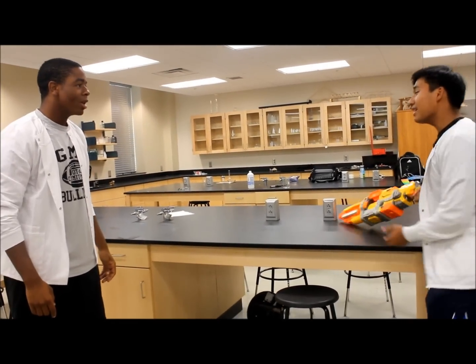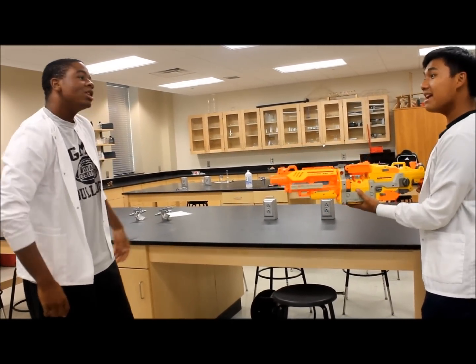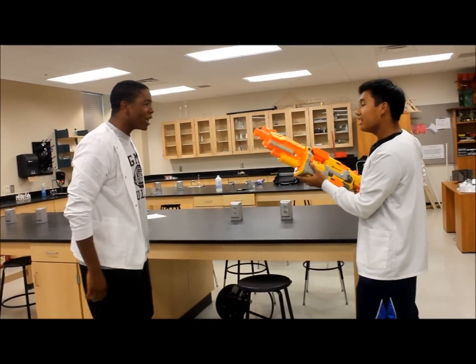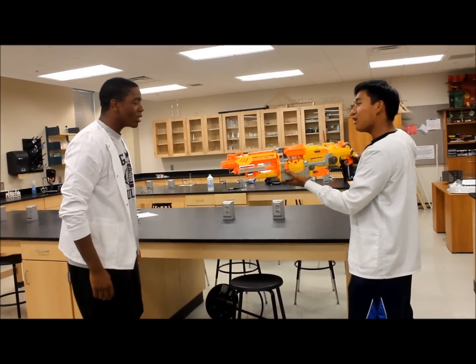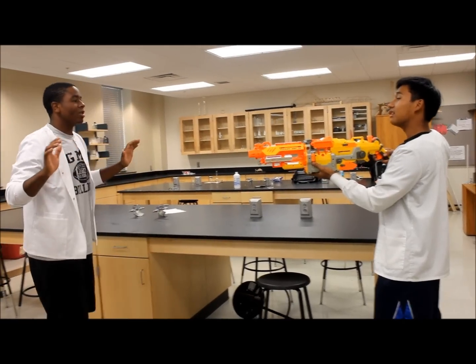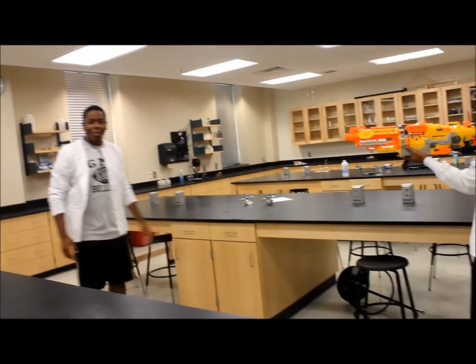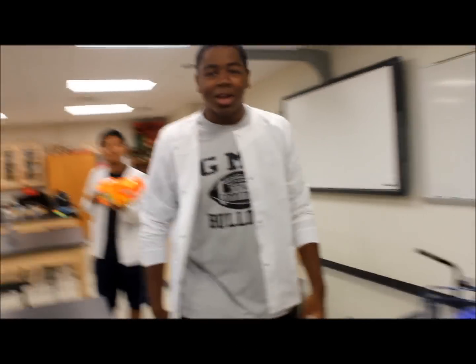Say hello to my little friends. This is my gamma ray. I made out of uranium. What you gonna do? Bust a move then, partner. Yeah, come on. What's come up, man? You don't even got it. Fight! Hey. Oh, he's scared now. Hold on, what you talking about? Who's scared, man? What's up then, dog? You wanna talk then? Hey, I'm just the one holding the camera.